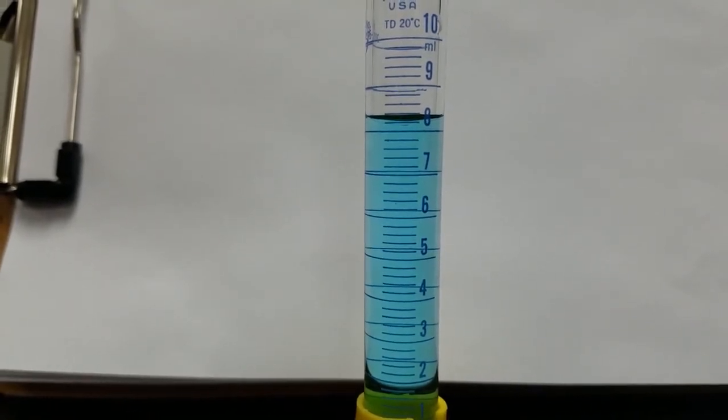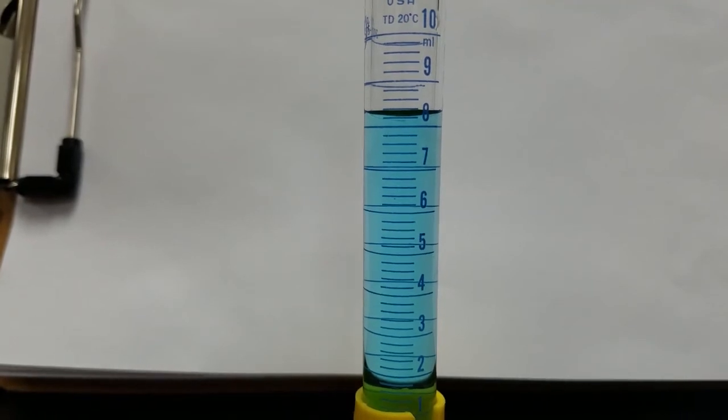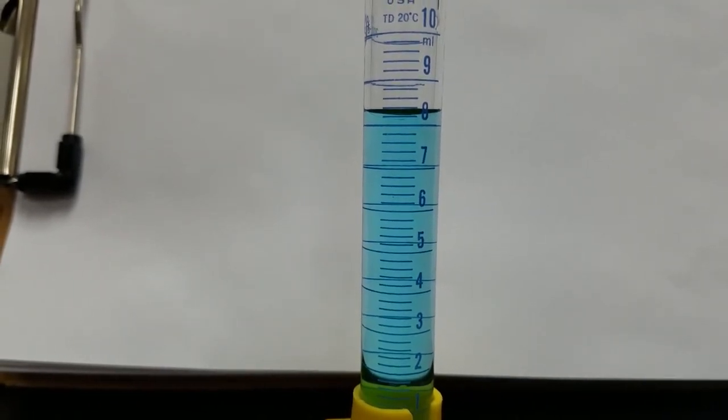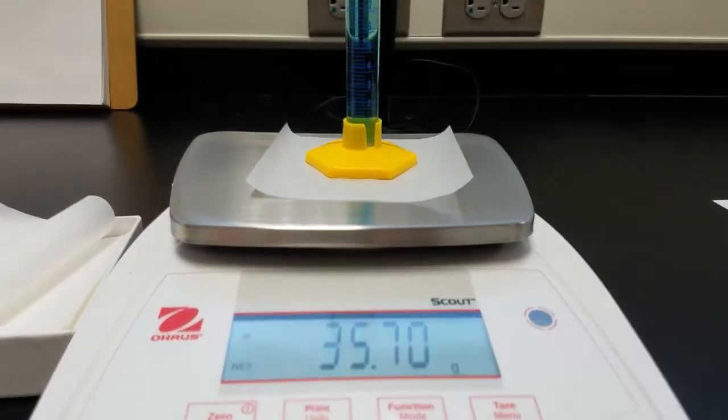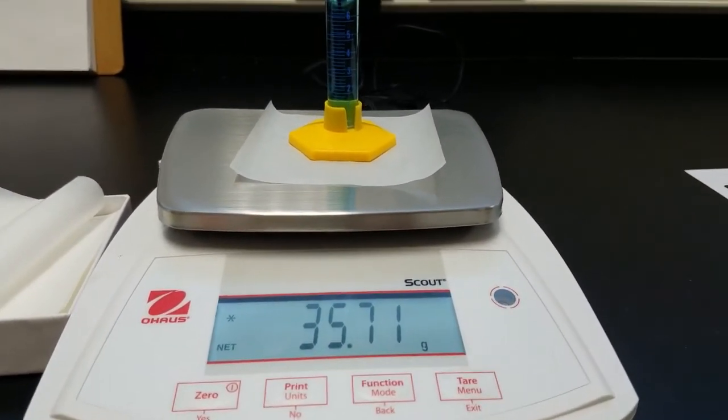An additional two milliliters of water has been added. Record your volume. The mass of approximately eight milliliters of water.